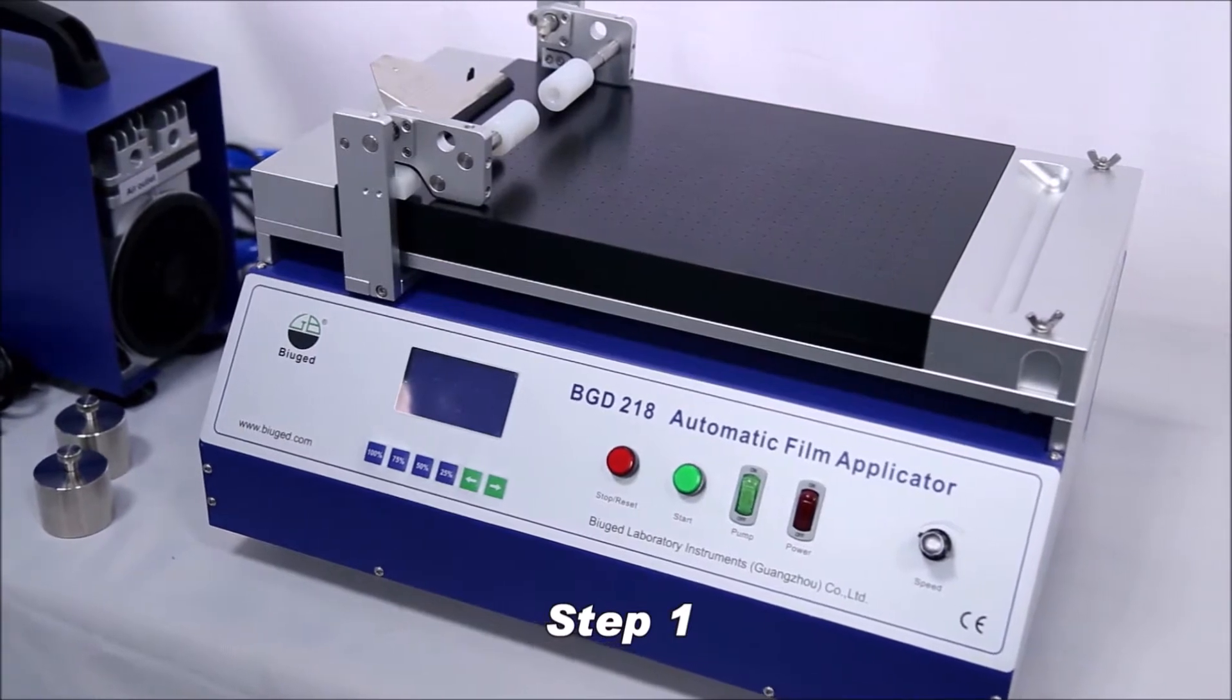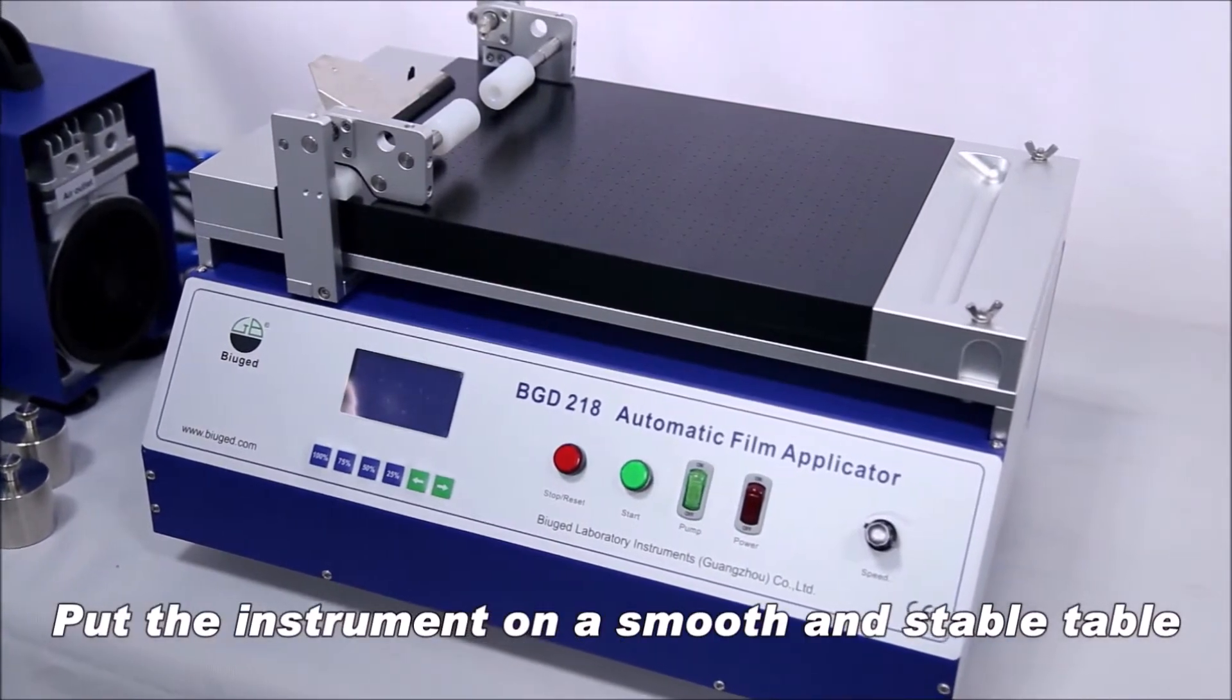Installation. Step 1: Put the instrument on a smooth and stable table.